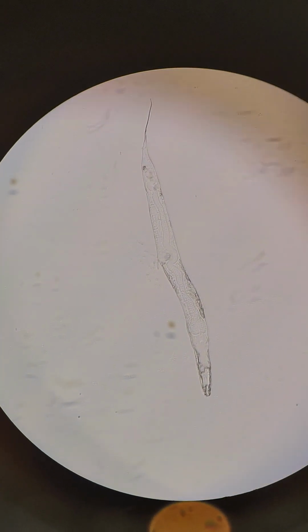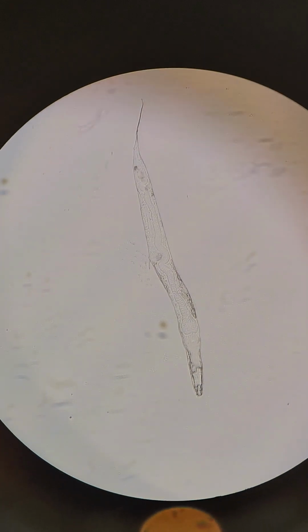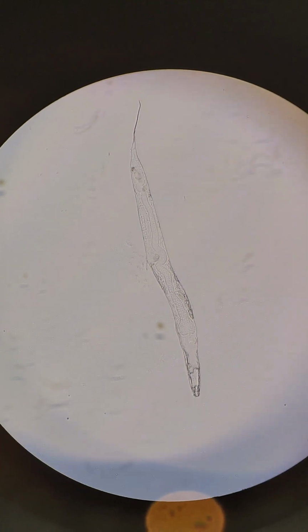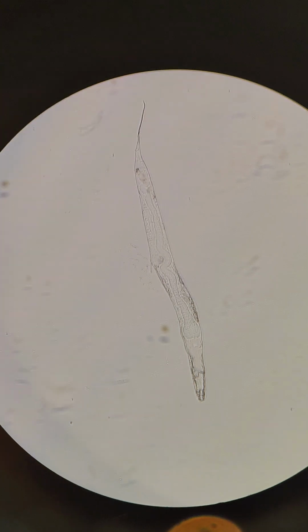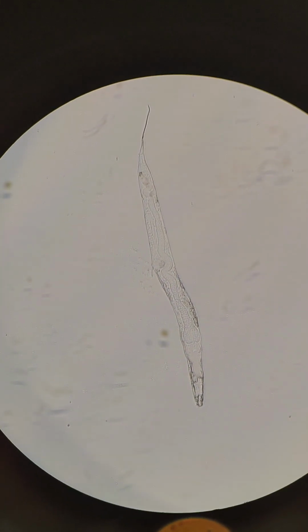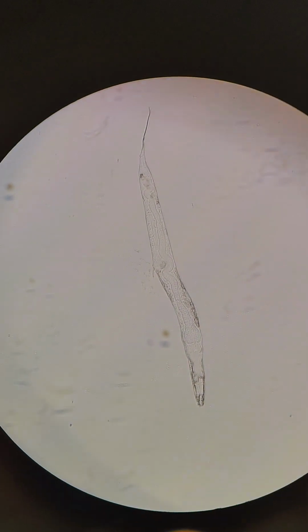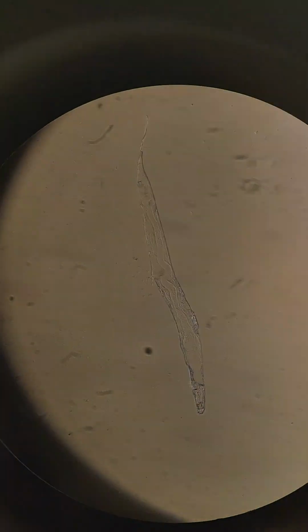You can see really well his whole intestinal tube. That's pretty cool. About midway through on the left side, that is the vulva, and then I believe the rectum is all the way at the end. I'm not entirely sure. But yeah, so now that we have him in our sights, we will go ahead and switch to the laser part instead of just the lights. So give me a second and I'll show you how to do that.